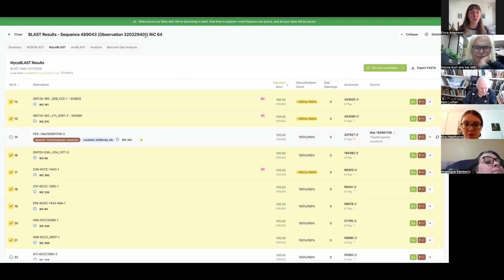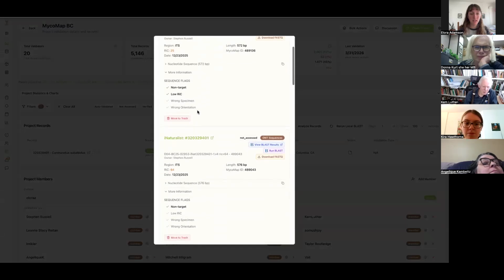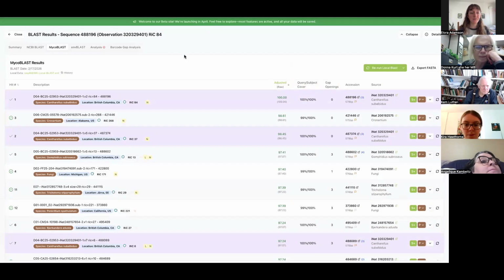I am going to note down this is sequence 043. It has 64 reads, and I bet it will have marked it non-target for me. So here's sequence 043, 64 reads, non-target. There's an algorithm now that can recognize things being non-target and mark them as this. So let's close that one. We definitely don't want that one.